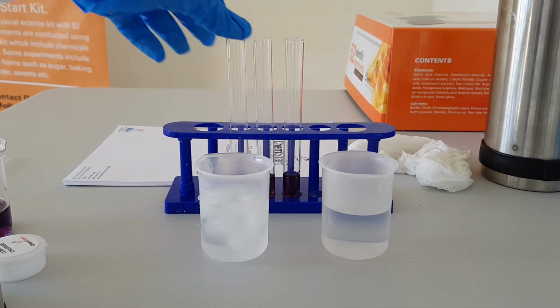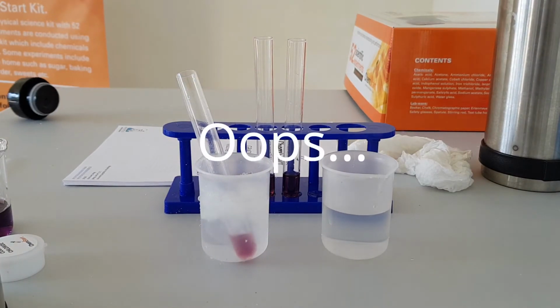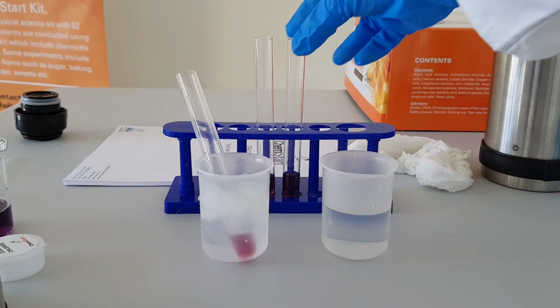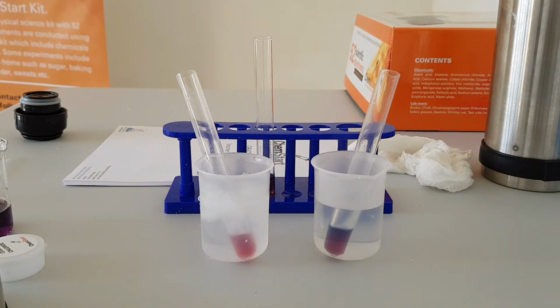I'm now going to put 1 test tube in the icy water. And the second test tube in the boiling hot water. And let's give them a few minutes and observe what happens.